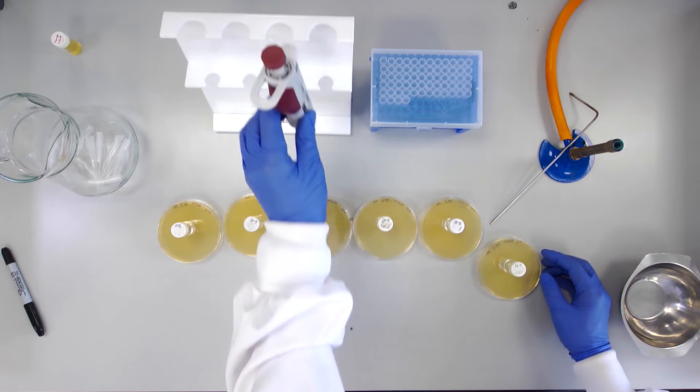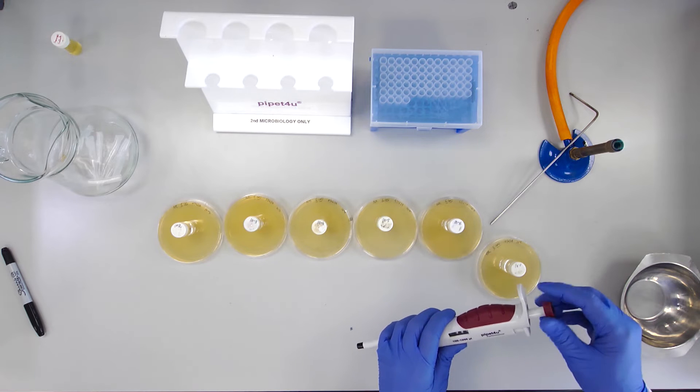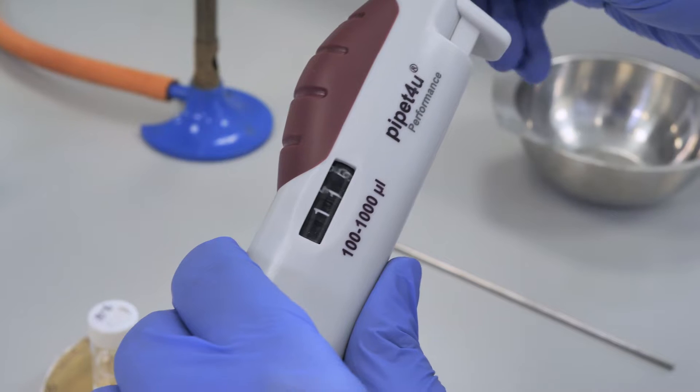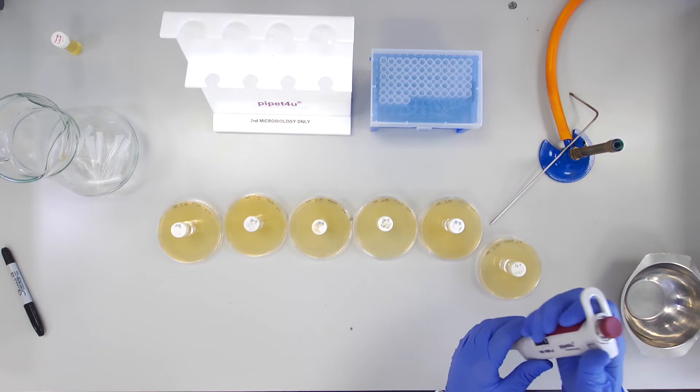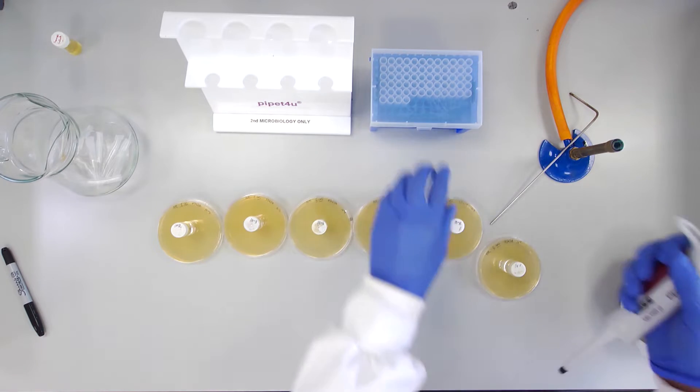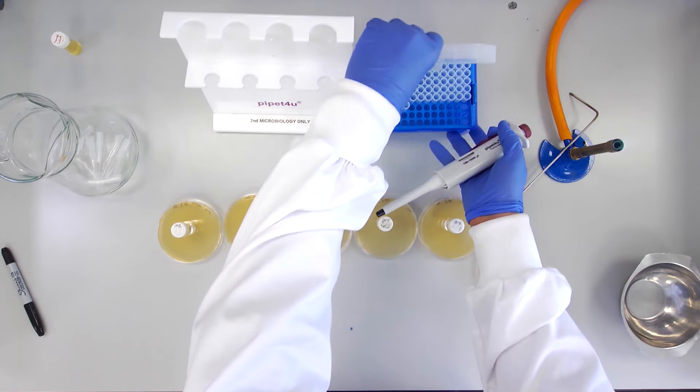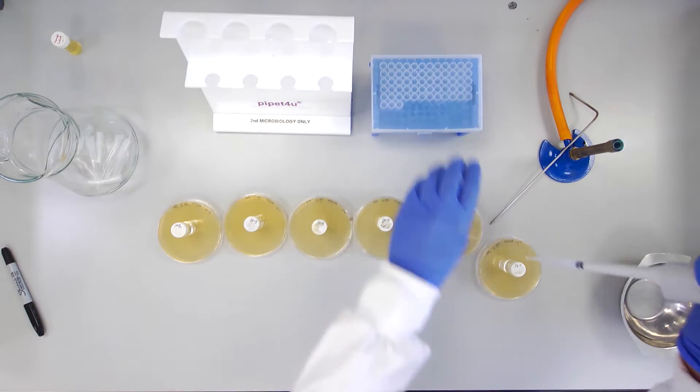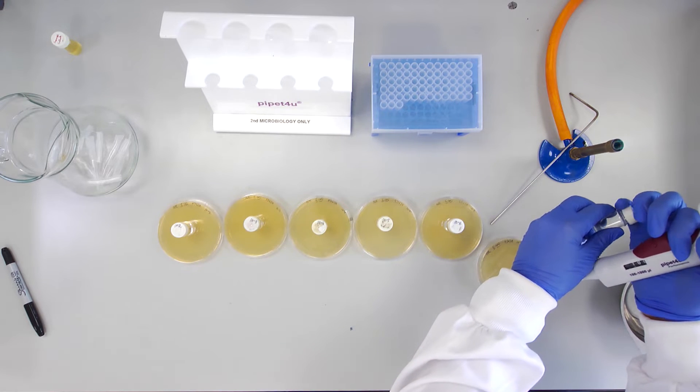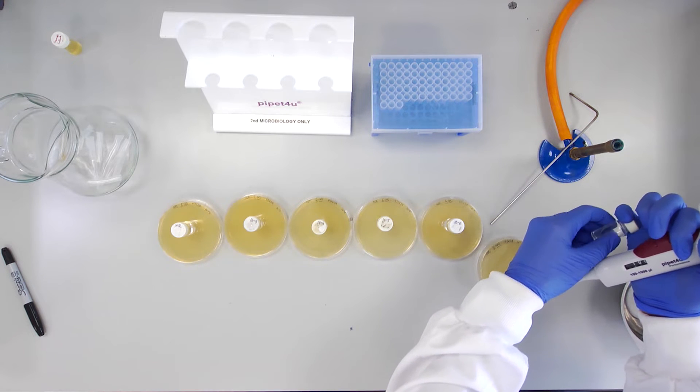Starting with a 10 to the minus 1 sample and using a 1 ml sterile tip, aseptically transfer 100 µL from the dilution onto its corresponding agar plate.